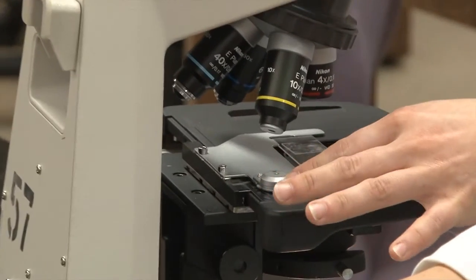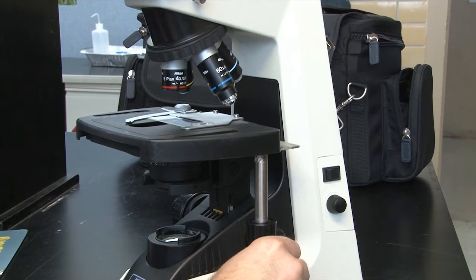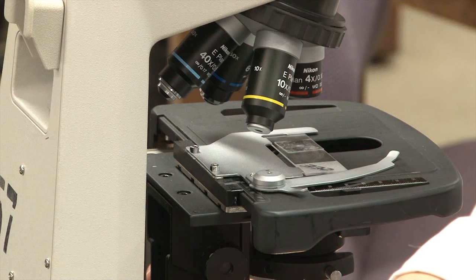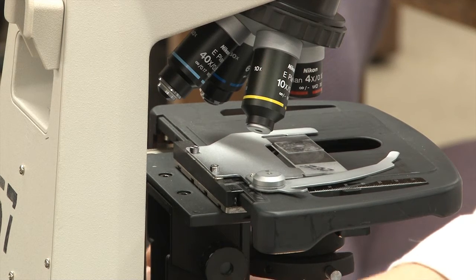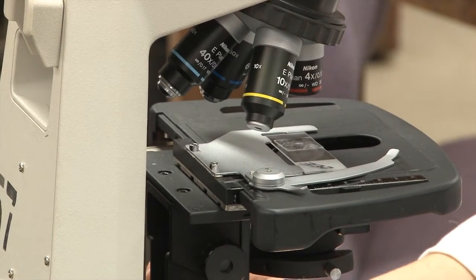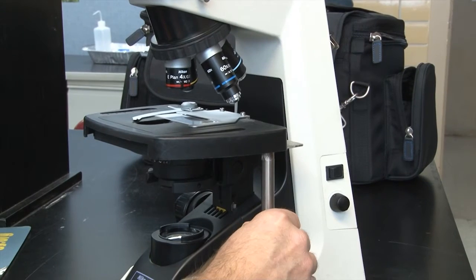Next you'll want to center your sample over your lens, so you'll check from the side and from the front to make sure it's in the center. There are knobs here on my right that I'm moving in order to do so.